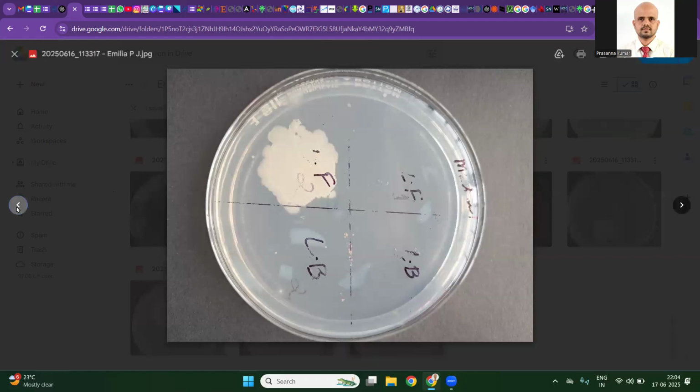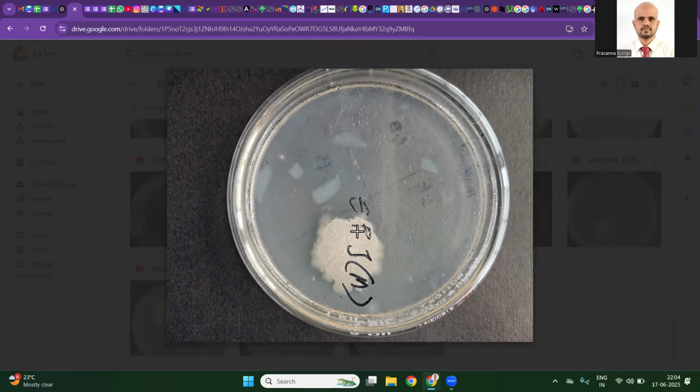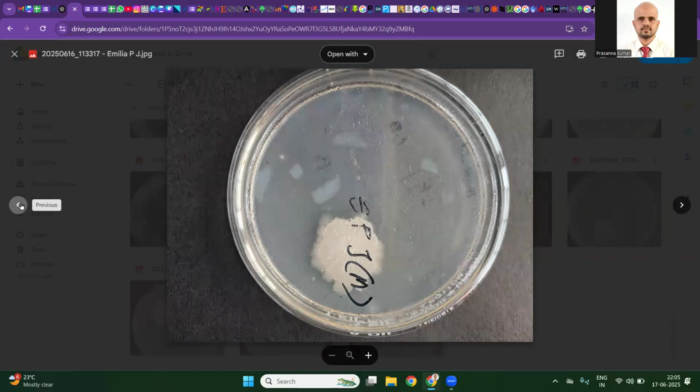So this plate is actually contaminated in this region. You have seen here, here also, this is Bacillus. If you stain them, you will see gram-positive endospore-forming non-motile rods. They are everywhere; they can even withstand high UV, maybe because of EPS, I don't know, extracellular polysaccharide. That's why they appear as wrinkled colonies. If you are getting this, either you are introducing contamination or you did not prepare your laminar well.